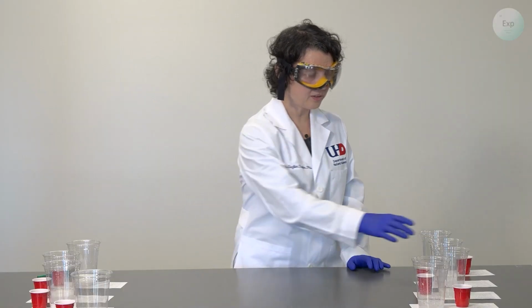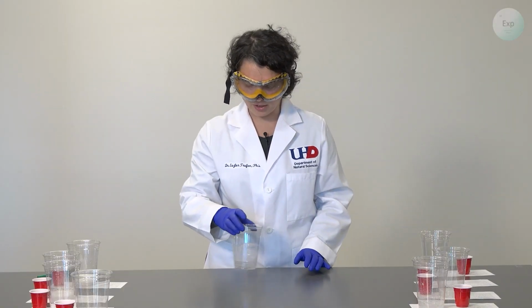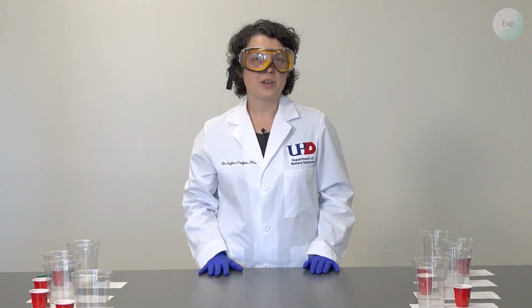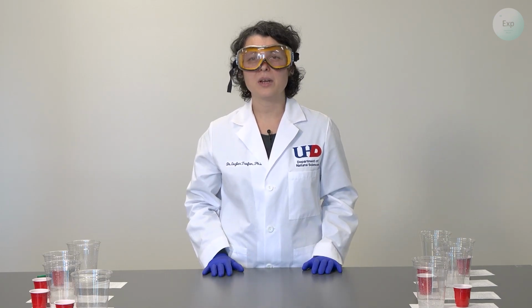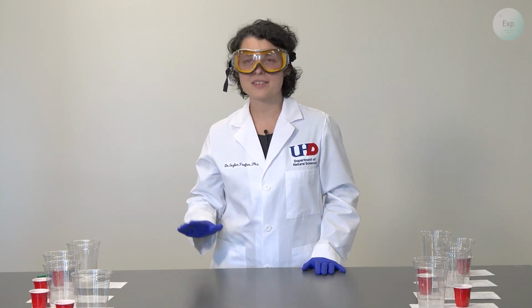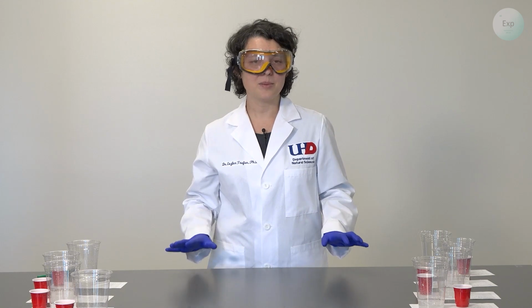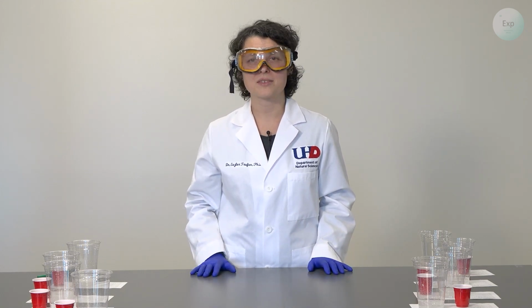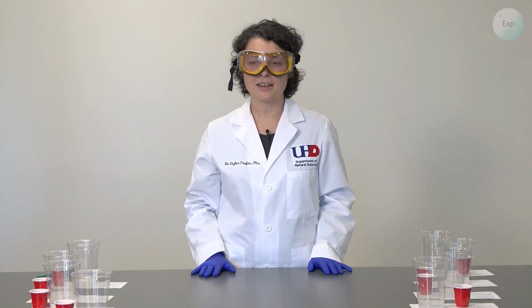If we swirl it a little bit, it helps drive off the carbon dioxide a little bit faster. So for the next about 15-20 minutes at least, what we're going to do is swirl all of these and check for bubbles, and then keep doing that until we observe no more bubbles in any of the cups. At that point, we will check back in with the experiment and collect the mass of all of them.